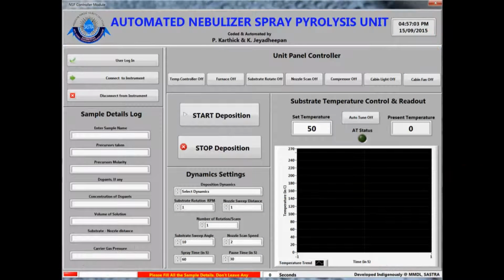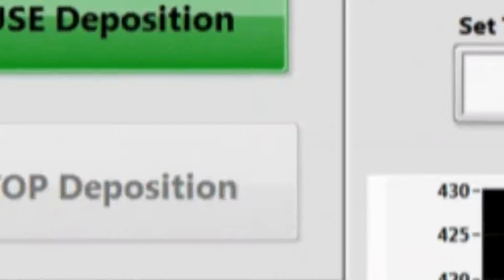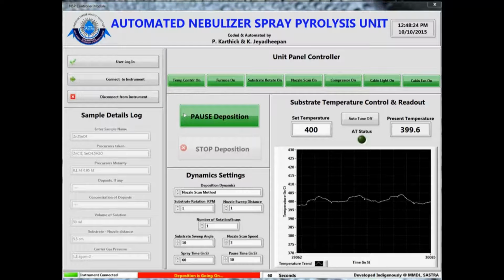This is the screenshot of the software developed for the automated operation of the nebulizer spray pyrolysis setup. The software is developed in such a way that it is intuitive to the operator. It will give commands during the operation in the status bar of the software itself. The software is completely developed in the LabVIEW environment. LabVIEW gives and gets the commands to and from the embedded microcontroller board of the instrument and controls all the process parameters during the deposition accordingly. The microcontroller used in the instrument is an Arduino-based microcontroller.